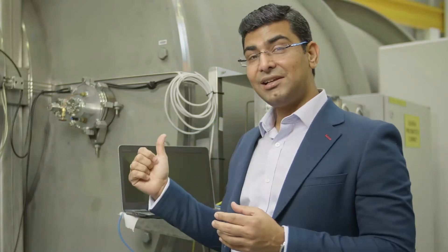QUOKKA's detector is the only detector in the world which can take a very high flux of neutrons — it's a state-of-the-art detector. As I explained, it moves from 1.3 meters all the way to 20 meters. This gives you a very big size range, from one nanometer all the way to 700 nanometers.